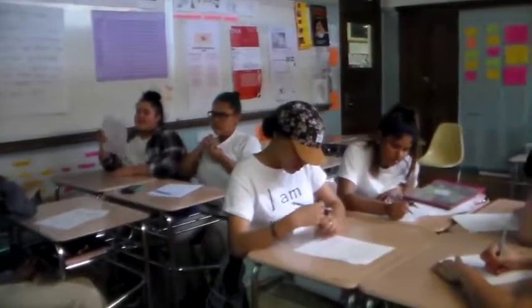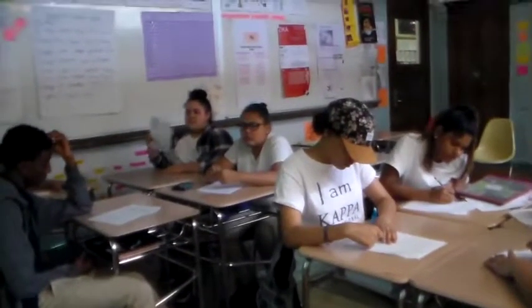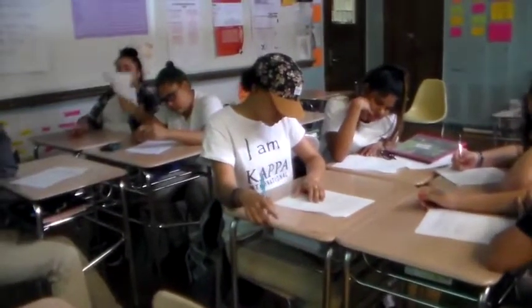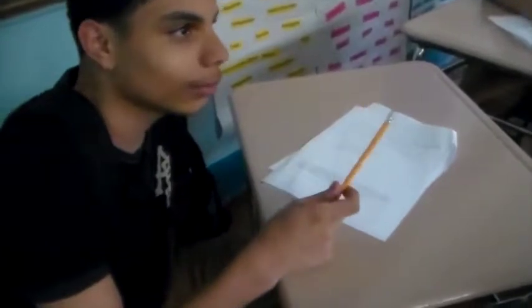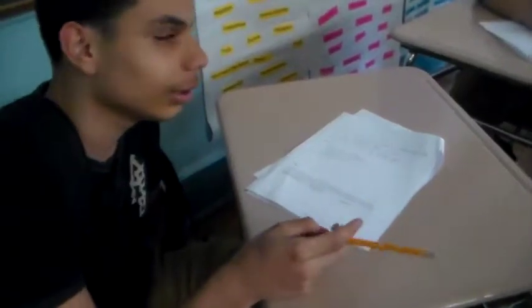you have a known concentration of a base and an unknown concentration of acid. I want you to incorporate those two facts into your hypothesis and refine your hypothesis. Not change it, refine. We add the same amount of acid, that is 1 mole, to the same amount of base, that is also 1 mole. I think that the indicator will turn pink. I think it makes sense because if there's a mole of acid and then a mole of the base, then they'll neutralize and then the indicator will turn pink, because they'll have equal amounts.